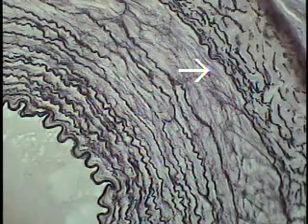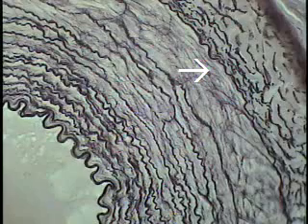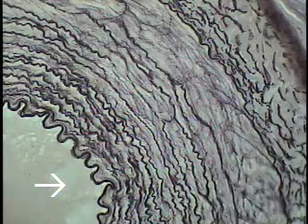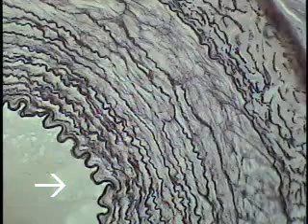So this is another muscular artery, but one that has been stained specifically to demonstrate the elastin, and the other morphological features are not obvious in this particular preparation. So it does have an advantage. You get a better idea of the elastic tissue that still remains within many of these muscular or distributing arteries.